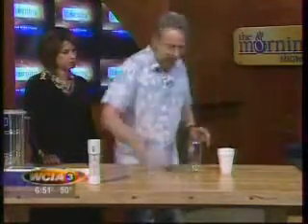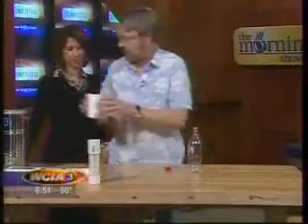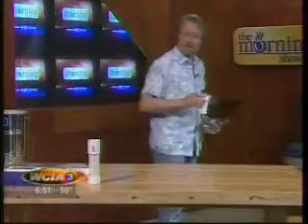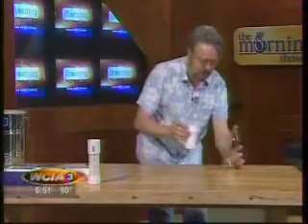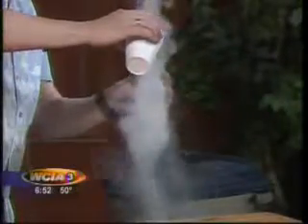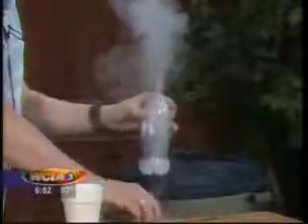So I'm going to start by just placing this in here, like this. There we go. And we've got a lid on for safety. And put the lid right, and then going to take some liquid nitrogen here. So probably what you want to do is move over there, because what I'm going to do is do this kind of rapidly, and then I'm going to kind of run for it. Okay, got to make sure I do this in order. So we pour the liquid in there, not too much. We screw the lid on tight so the expanding gases have no place to go.